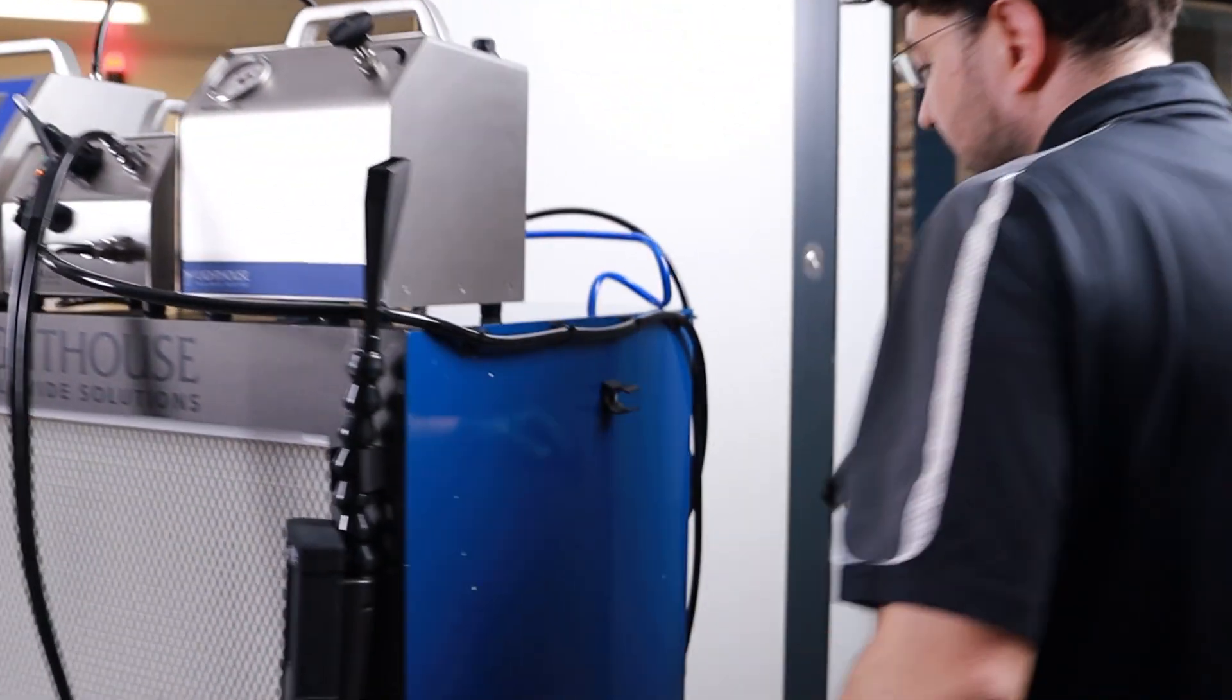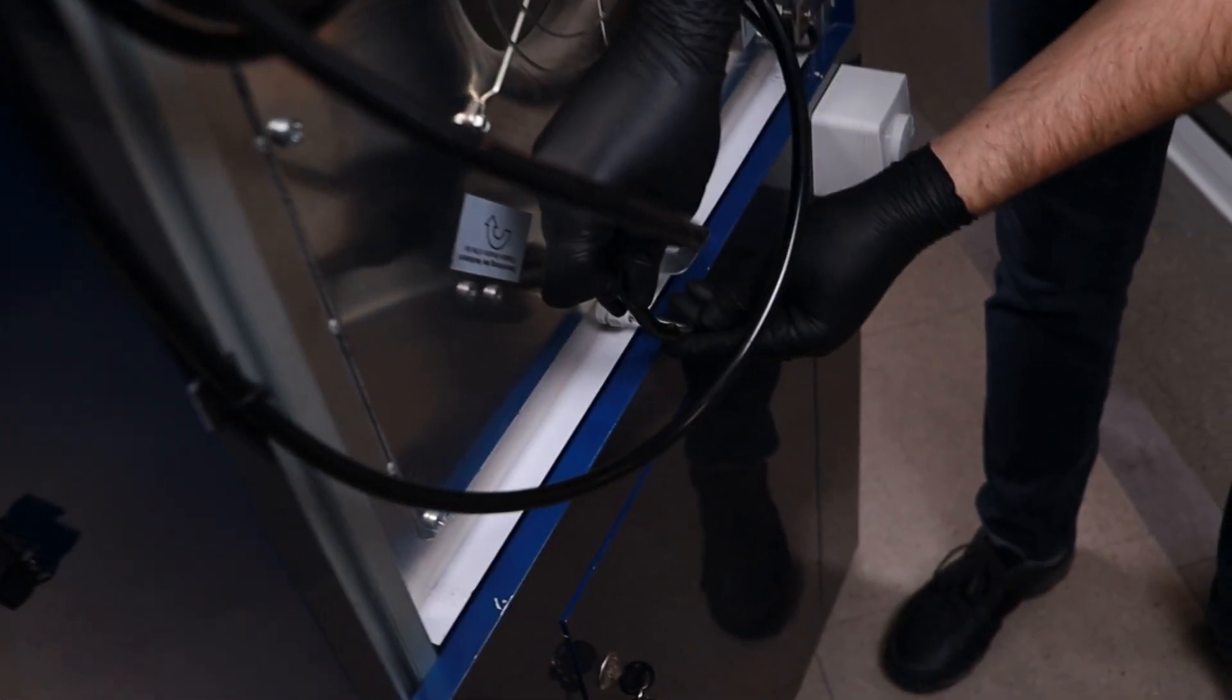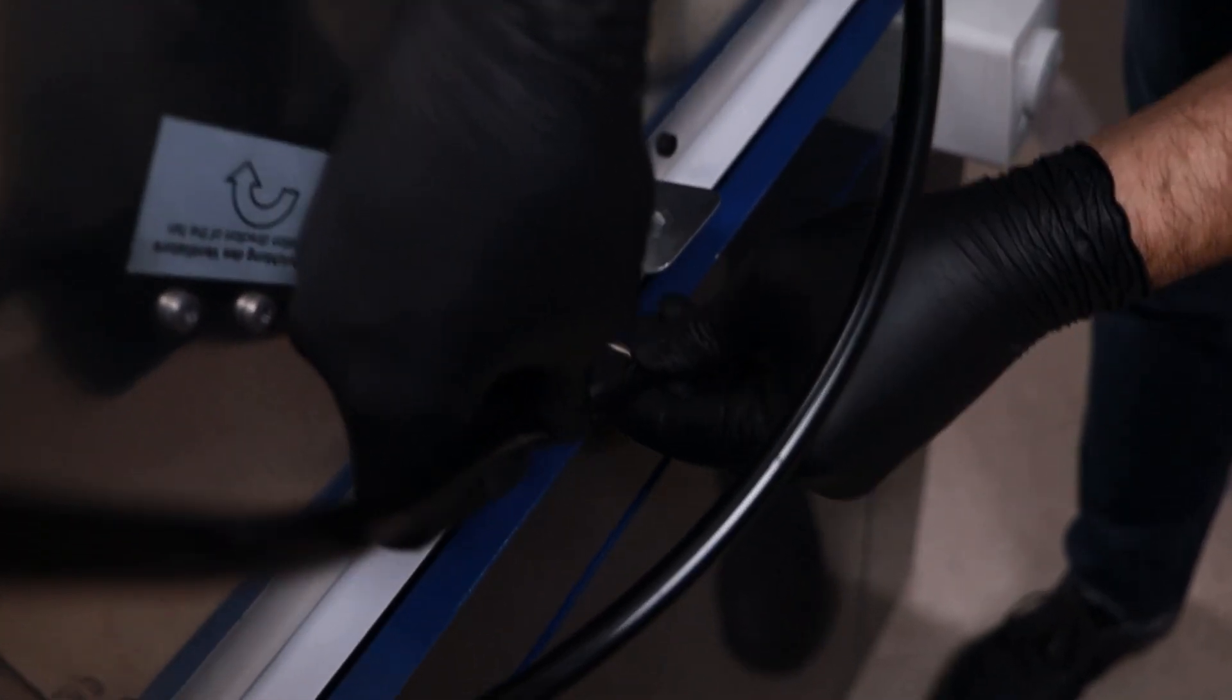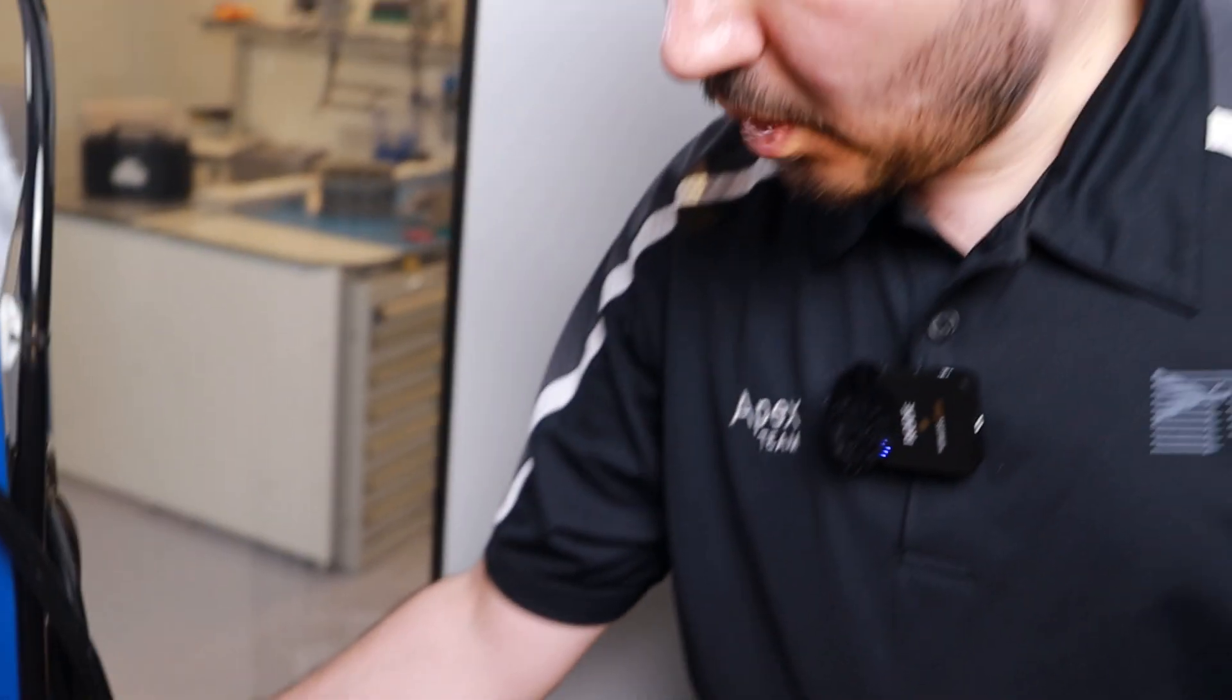And behind the unit, there will be another connection point for the upstream port. In our FFU unit, we have these upstream ports ready. If your system doesn't have any upstream port such as this, you need to open it up so that you can take the sample.